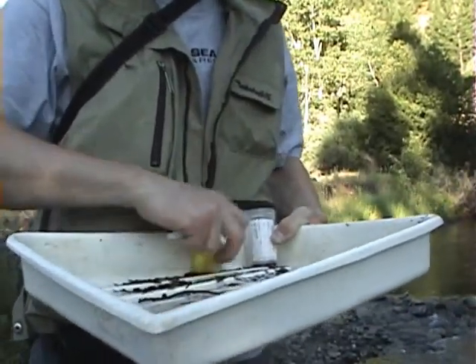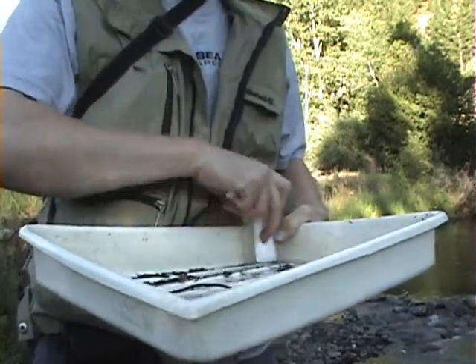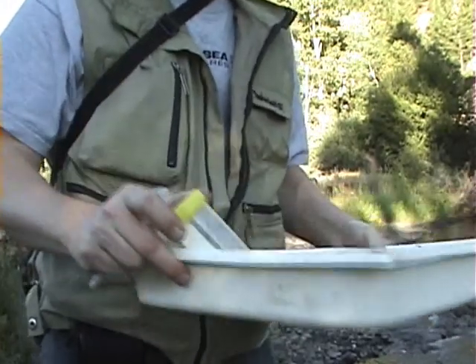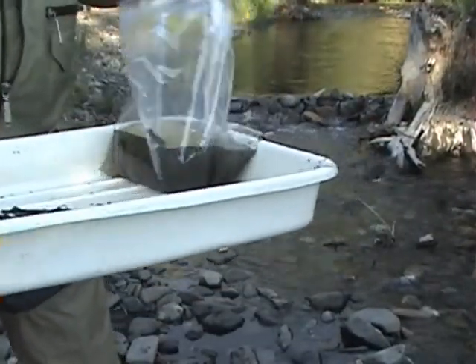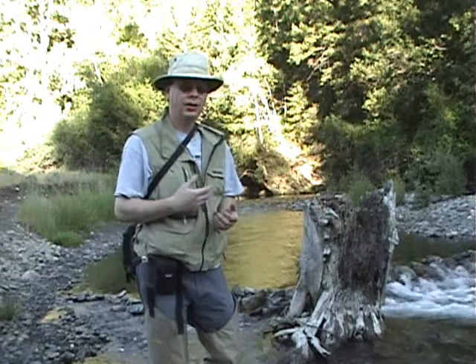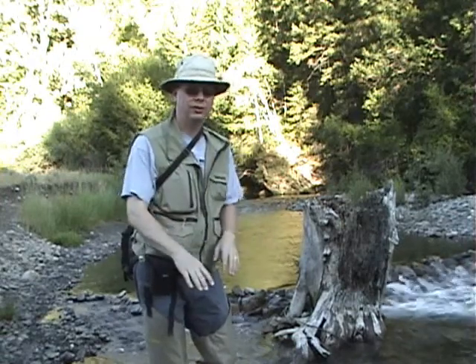Once you've removed them to the jar, and I'm just using a sterile urine container — it can be any sort of jar that's clean — then you can cap it, put it on ice, and take it back. You can always take an extra kick sample with you and keep this in a refrigerator alive until you're satisfied that you've sampled appropriately for any given time. Another technique that one can use in a system like this is to just pick up some vegetation, some of the substrate. Some of these insects will be more clingy than some of the ones we've just collected.